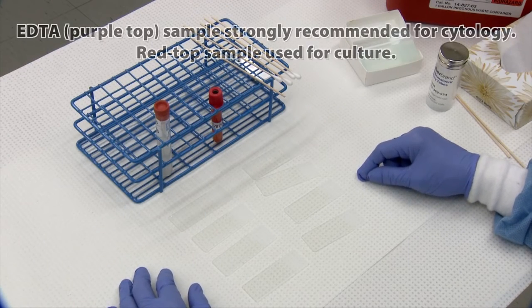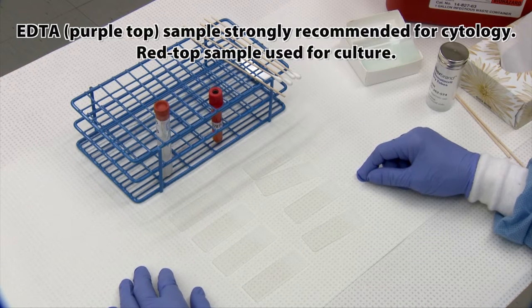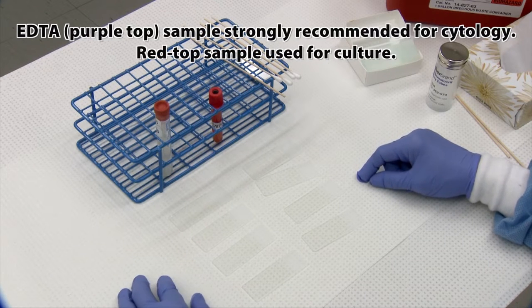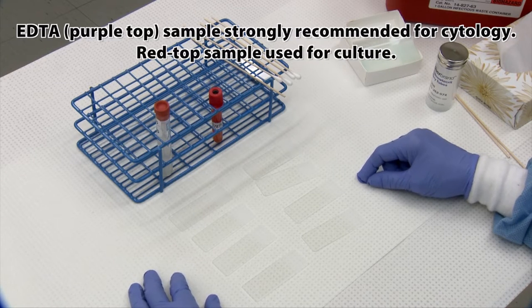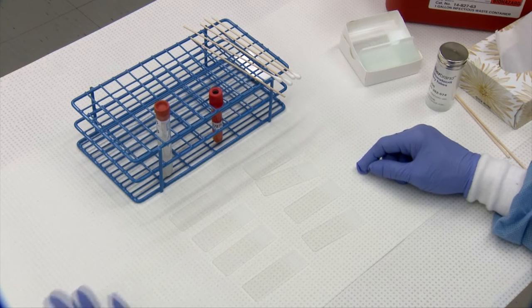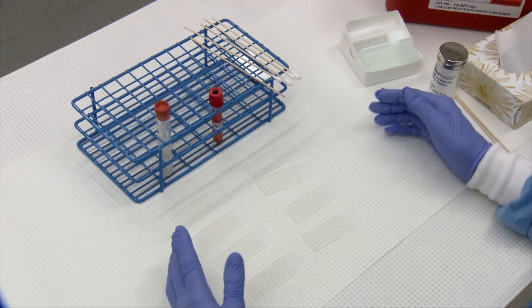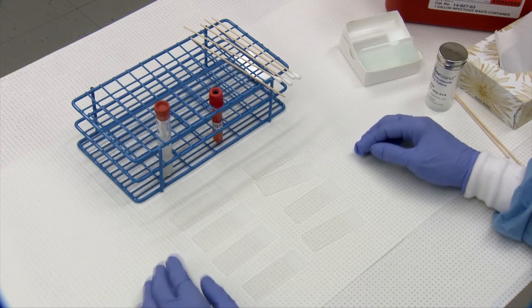This section is going to demonstrate how our lab handles and processes body fluids for cytological examination. Our fluids are basically divided into two types: body cavity fluid and non-body cavity fluid.